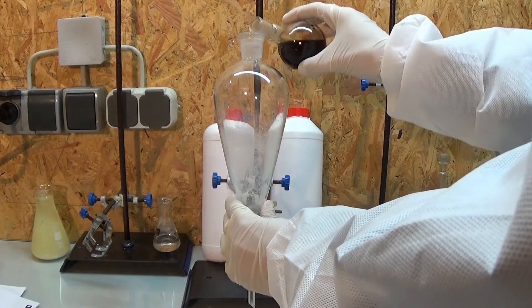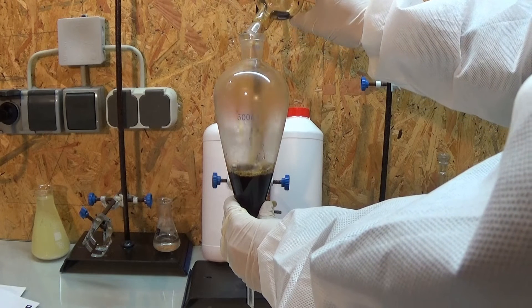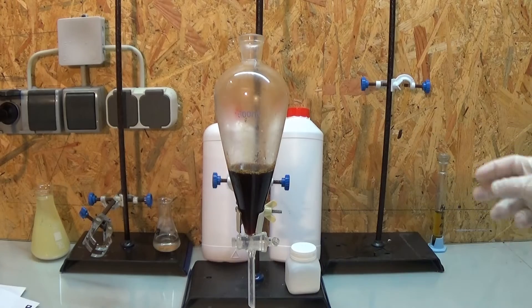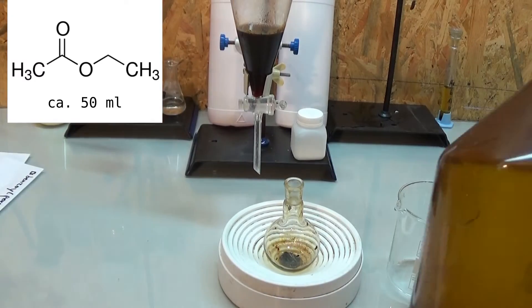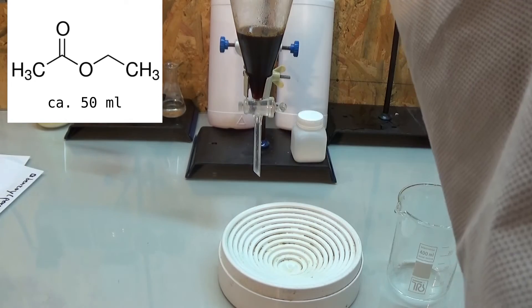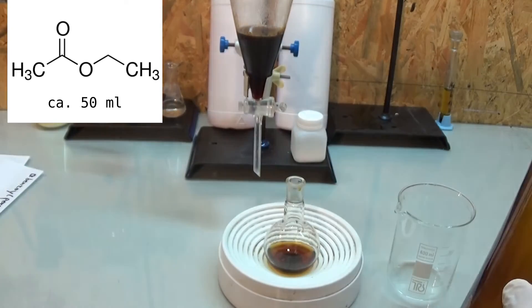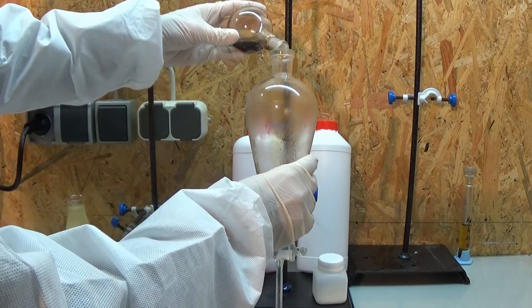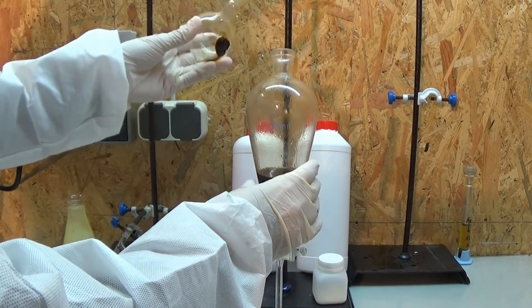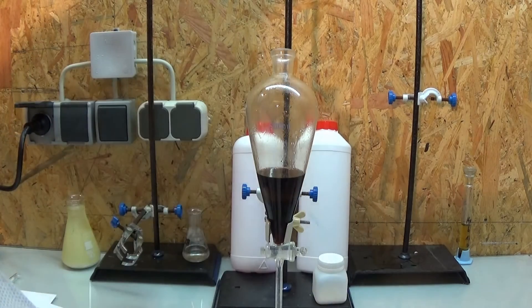To get rid of side products, the reaction mixture is washed several times with ethyl acetate. This works because we just generated the water-soluble potassium salt of the cinnamic acid, which in turn is not very soluble in organic solvents. Most of the side products are quite soluble in organic solvents so they can get washed away. For the washing, the extracting solvent is added to the reaction mixture in the separatory funnel, this is then capped and shaken vigorously. After each shaking you should vent the separatory funnel, depending on the volatility of the solvent, to release the built-up pressure.